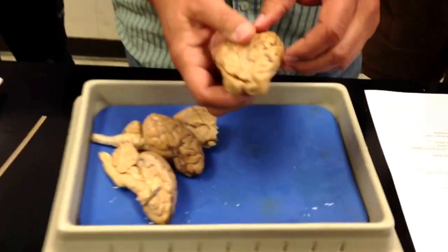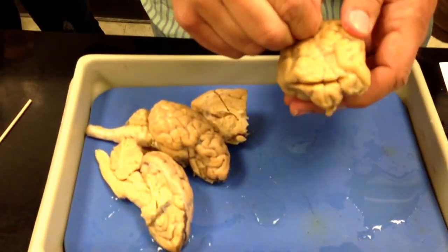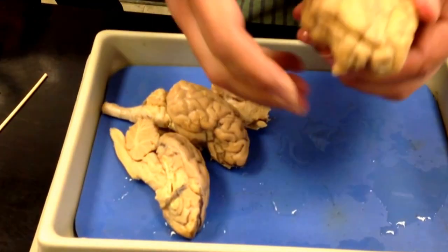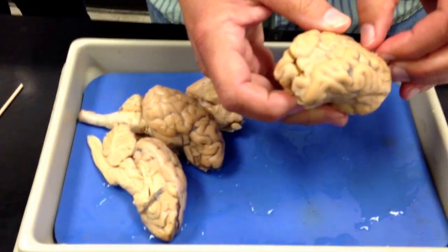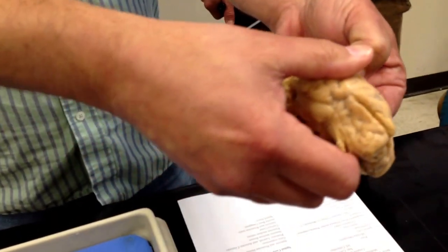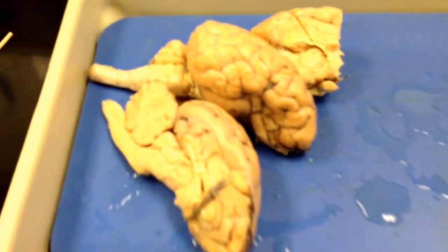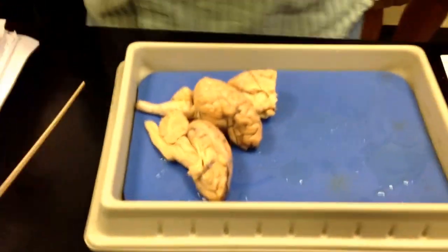Meninges, okay? And the outer layer, the dura and so forth, they kind of come off when you... Can you peel the pia off? You can. That's what I'm trying to illustrate here. Can you see right there? Yeah. That's what I'm doing. It's really thin. You can tell it's there because the blood vessels are embedded in it. It's quite thin, kind of hard, and fragile to pick up.